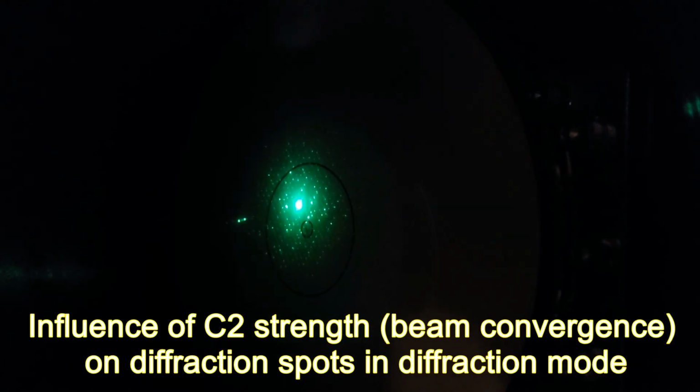And go back to diffraction mode and make sure that I'm focused. This is a diffraction with a convergent beam or a divergent beam. This is the way we normally want to image. When I change the intensity knob, the beam goes in and out of parallel condition. You can see the contrast change in the diffraction. Go back to diffraction mode. You see the spots going in and out of focus.